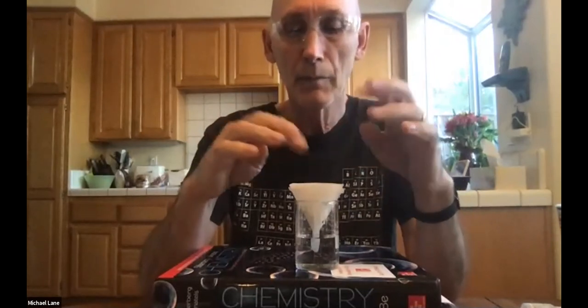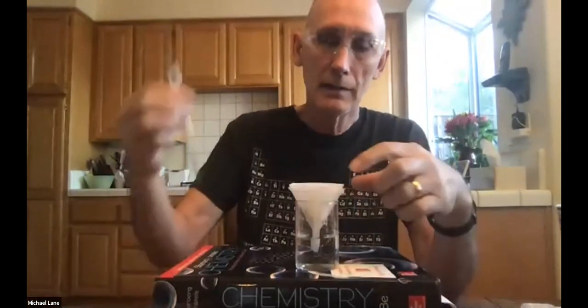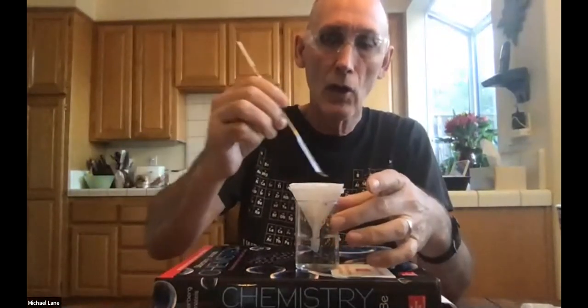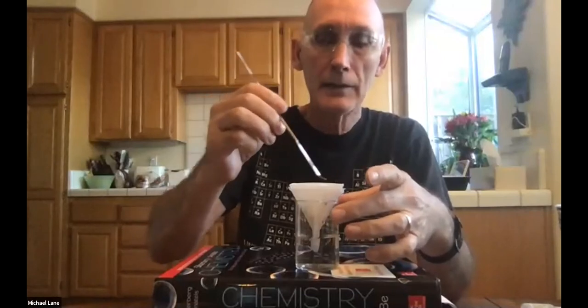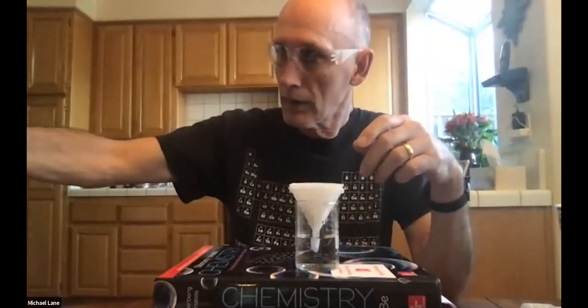There's just maybe a little bit of moisture in there. And I don't know if this step is in the HOL procedure, but I'm going to give it to you now. Since this filter paper is all wet, inside the water that is in this filter paper is sodium chloride, because anywhere there's water, there's sodium chloride. And we don't want those in there.